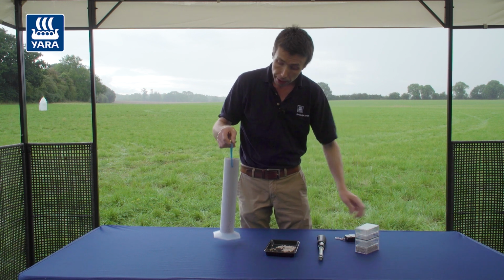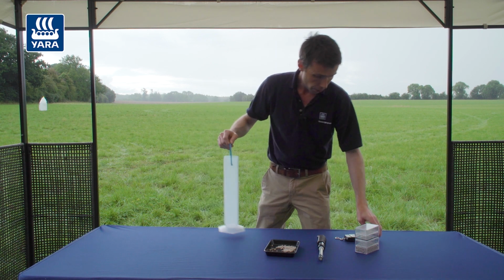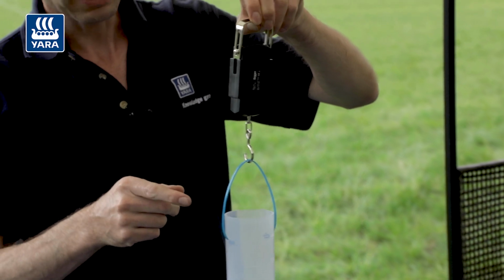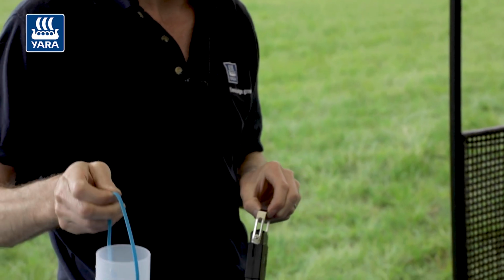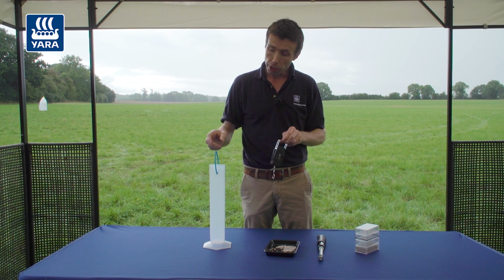So now we have to get a tare on the graduated cylinder. So we empty it and get a weight for this, and this is weighing 0.2 of a kilo. We deduct this tare weight from the initial weight of 1.2 kilos, so what we get is 1 kilo. So pretty much this product is 1 kilo per litre. The bulk density of this extra grass is 1.